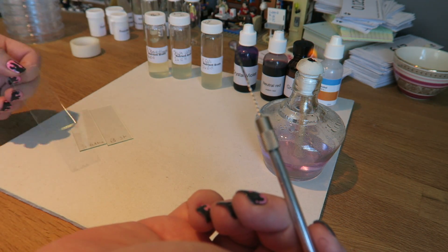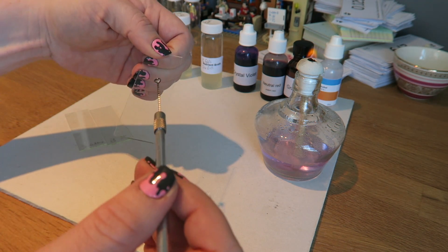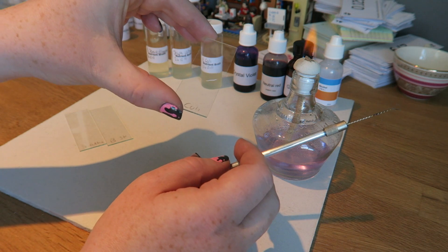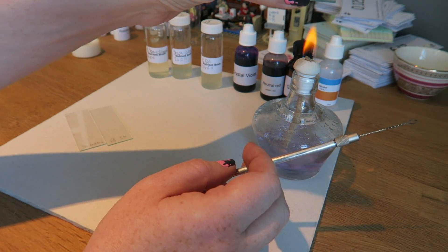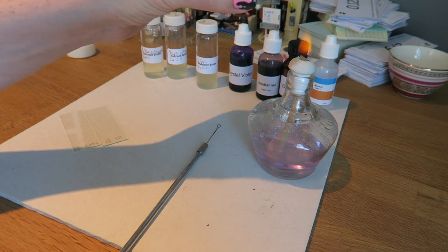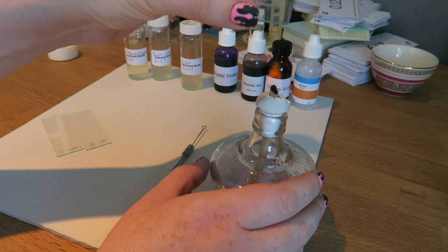I'm going to take my slide and put that on there. So my slide now has a drop of bacterial culture. I'm going to spread that around a little bit, then flame my loop to clean it. Then I'm going to take my slide with my drop of bacteria and just hold it above the flame — I don't want to hold it in the flame because that will crack the slide — just above the flame so that the liquid evaporates away and I'm just left with dried bacteria on my slide.